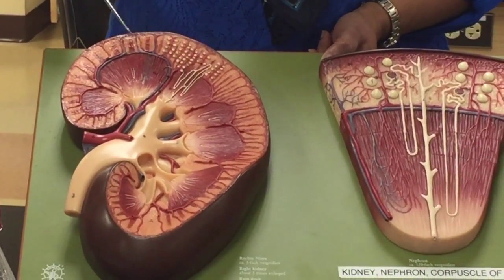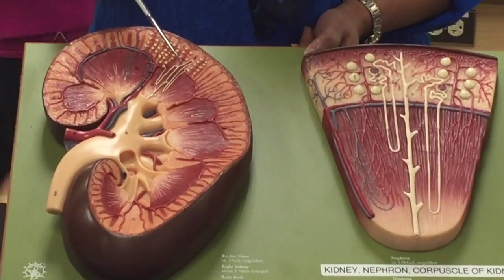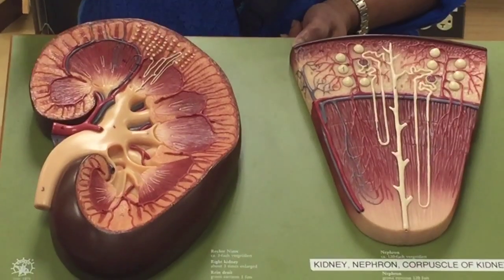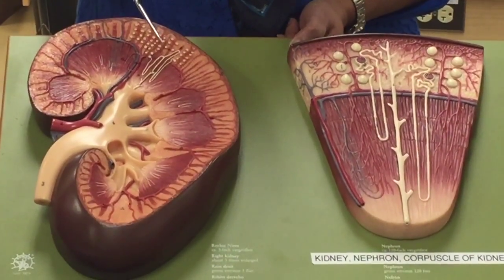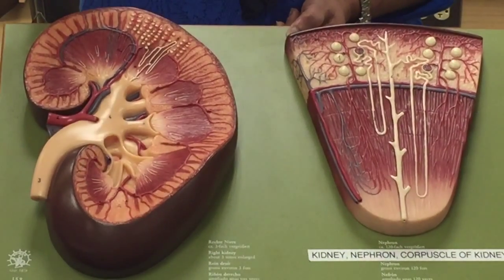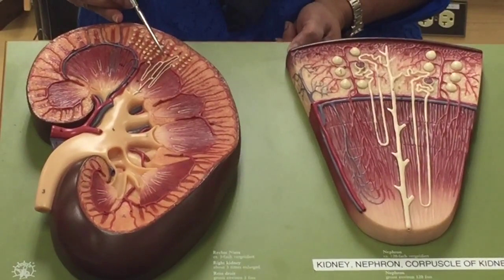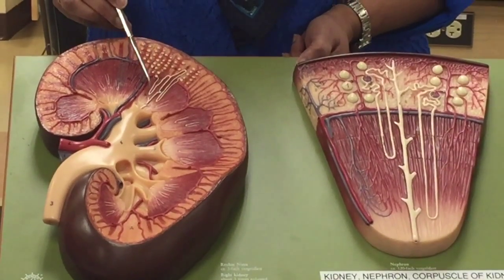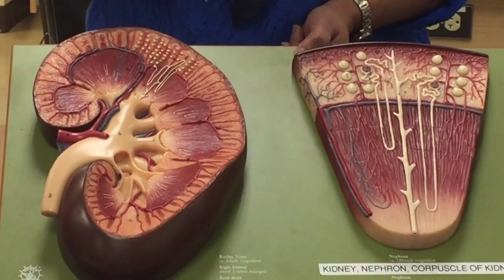The appearance of that granulation here is because of a component known as the glomerulus, which is where blood is filtered. Each of these rounded structures contains the glomerulus surrounded by a cup-like structure called the Bowman's capsule. Those collectively give it that granular shape. And then all the tubules dip down into the medulla and travel through it, and that's what gives the medulla the striped appearance.